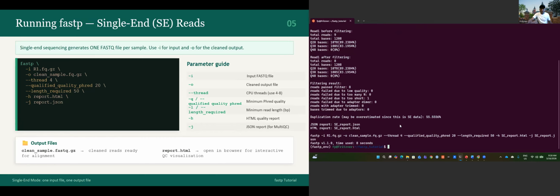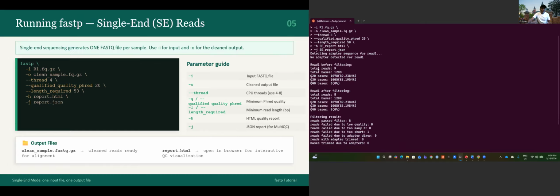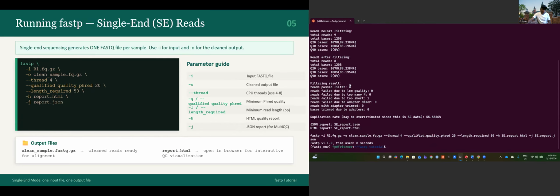It depends on your computer performance. So it gives you a report in the command line. You can see everything. For read1, before filtering total reads 9, and after filtering total 8. The filtering result: 8 passed the filters, and 1 failed due to being too short. You will have the same if you go and see the HTML report that's generated.